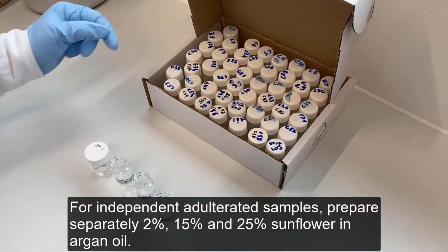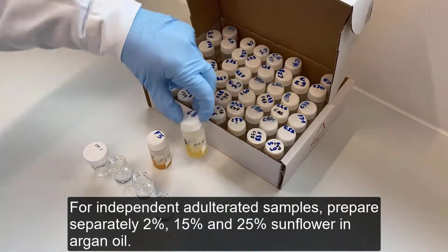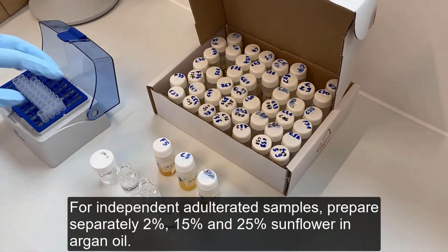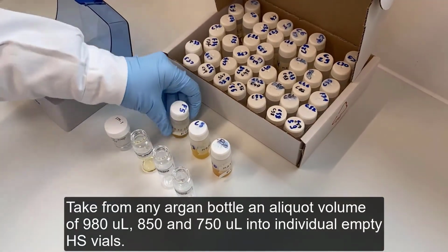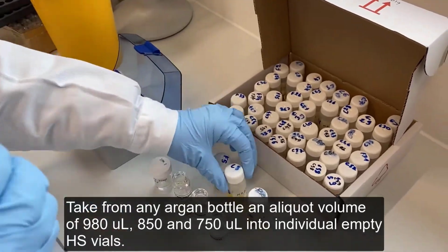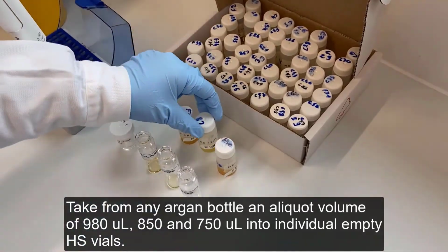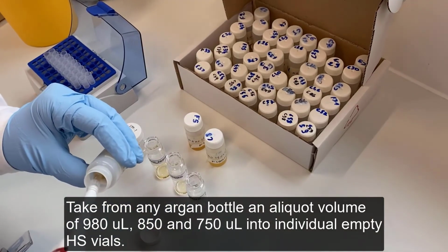For independent adulterated samples, prepare separately 2%, 15%, and 25% sunflower in argan oil. Take from any argan bottle an aliquot volume of 980 microliters, 850, and 750 microliters into individual empty headspace vials.